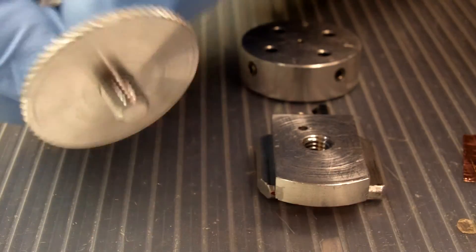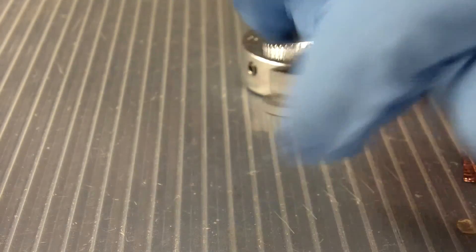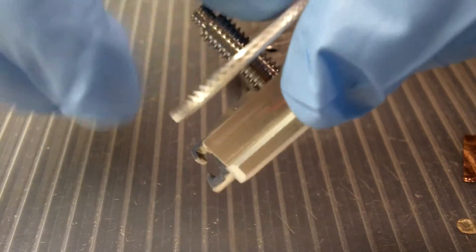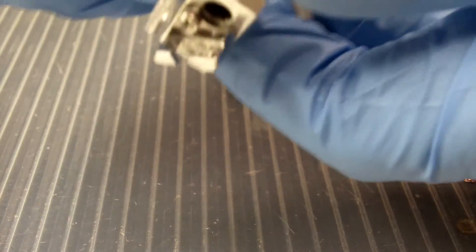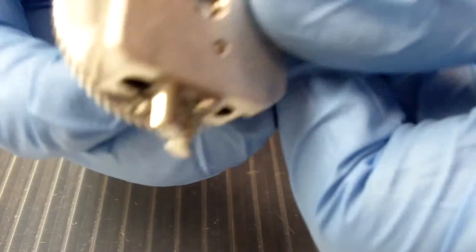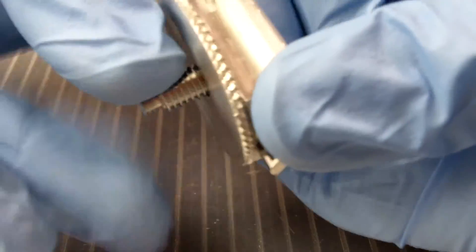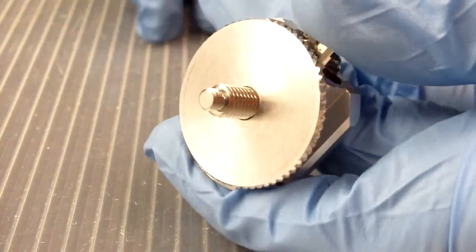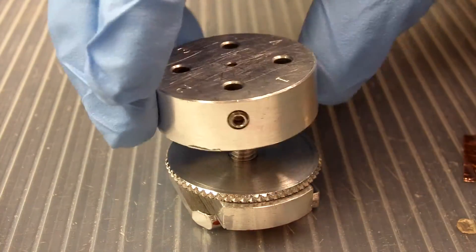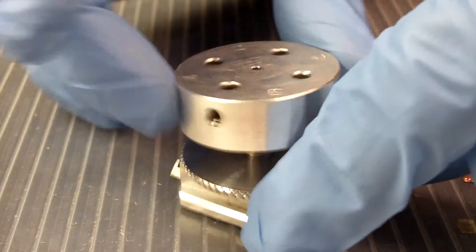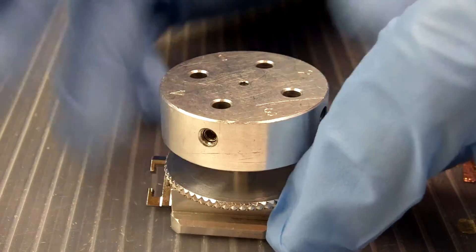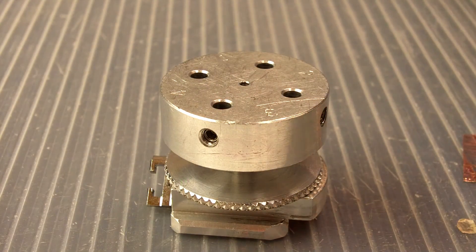The locking ring starts off going around the screw like this. We'll put the screw into the base like this. And then we make sure that the screw is not all the way in the bottom of the base. We're good. Then we'll tighten down the locking ring very tight. So tight that the screw does not move anymore. And then we're going to put the platform on the top. Very easy.